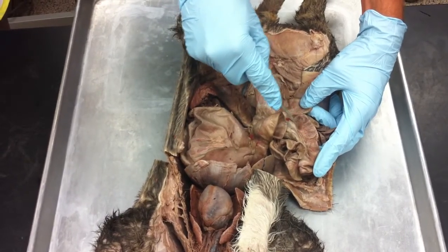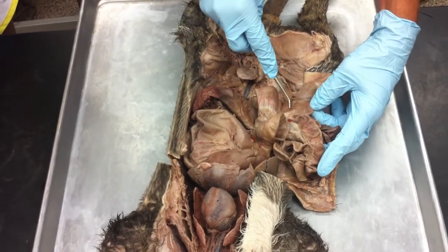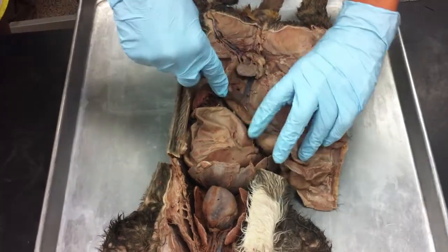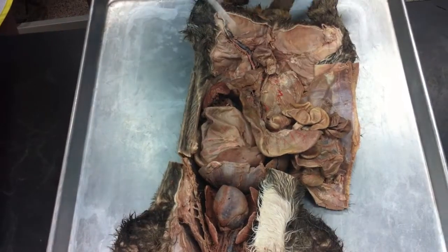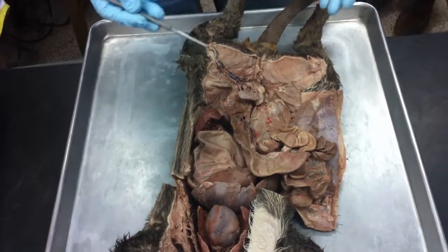And you can see the big difference. There's the width of the ileum right there, and here's the width of the large intestine. This first part of the large intestine, this little pocket here at the beginning, is called the cecum. And this whole thing is going to be the large intestine, or the colon. And it goes all the way down, and then you get down to the rectum and the anus, but you can see that on the diagram. So we'll identify rectum and anus on the diagram.